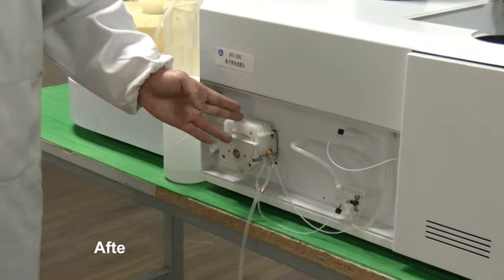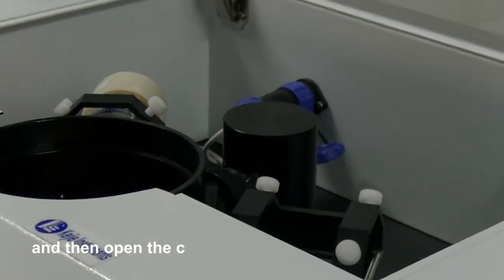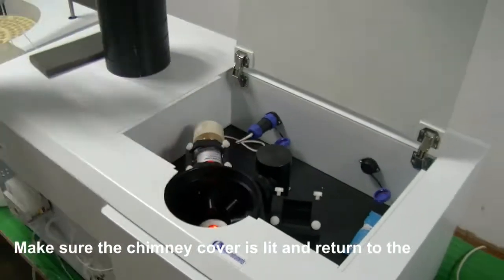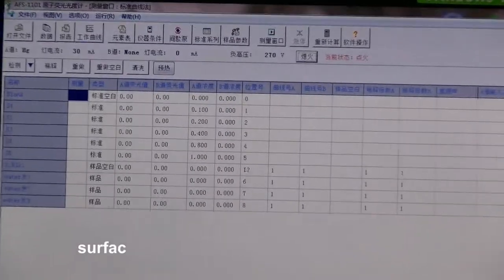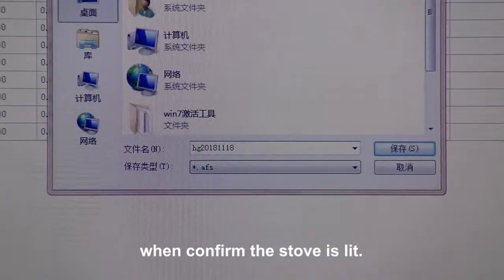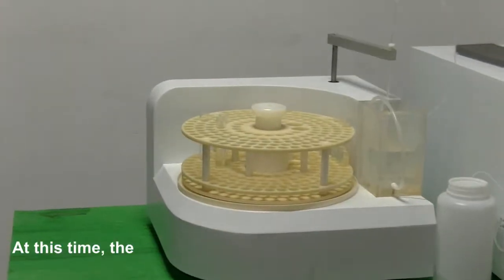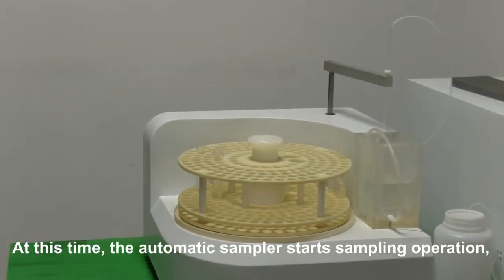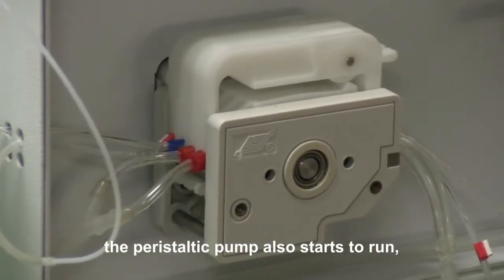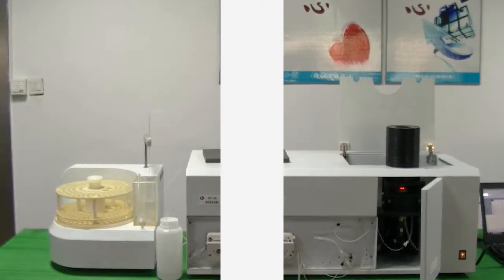Step 5 — Start the instrument. After the check, use the software to ignite and then open the chimney to see if the burner is lit. Make sure the chimney cover is on and return to the operating interface. Click on the test to confirm the burner is lit, then cover the chimney. Return to the operating surface and click Detection. The software will automatically generate a file-saving interface. Save the previous operation. The automatic sampler then starts sampling, and the peristaltic pump starts to run. The instrument runs normally; wait for the experimental results.